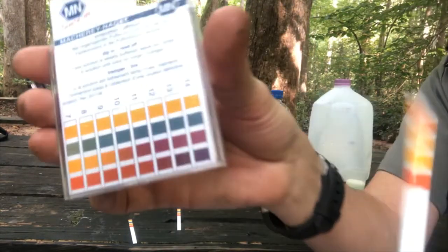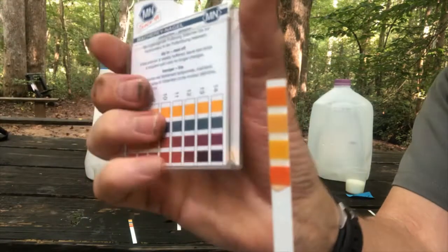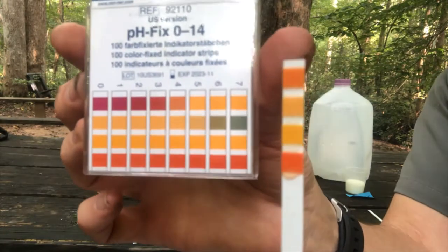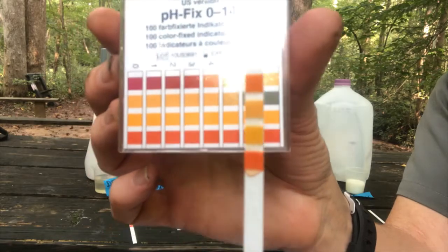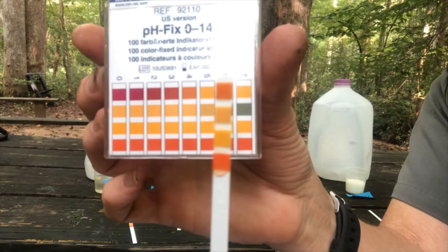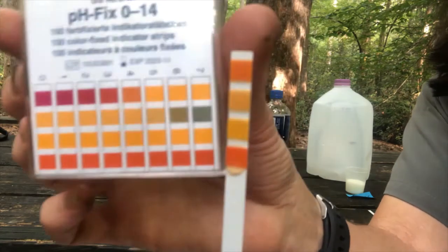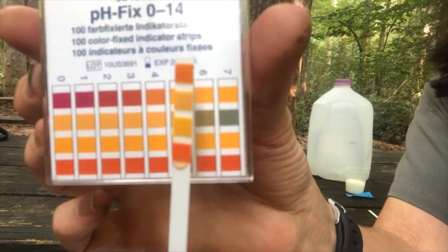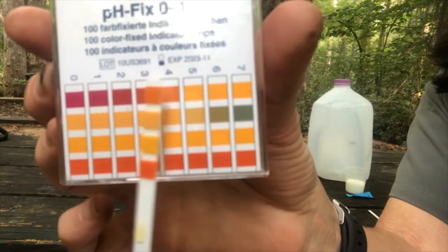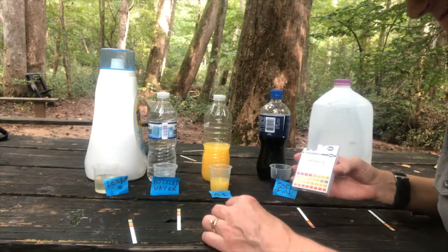Let's do orange juice. Oh, no greens here. Okay, we're not even going to fool with the 7 to 14 because there's no green showing. So let's see. So not 7 or 6, one of the others. So just looking at these colors, try to get the best match for these. Trying to see what will help us see it best. What do you think? Write down the number you think matches best for the orange juice, which is sample 3.